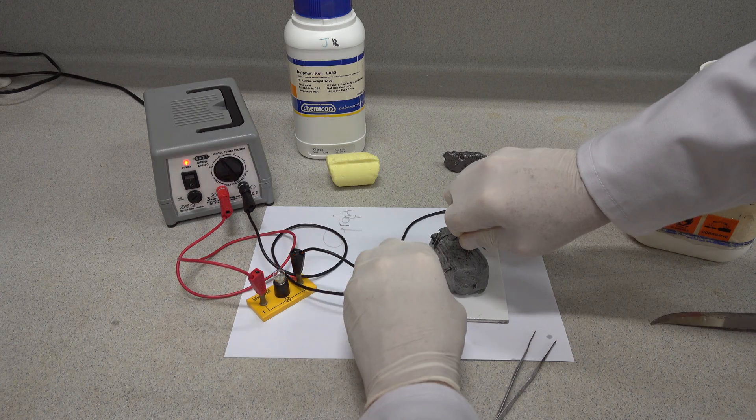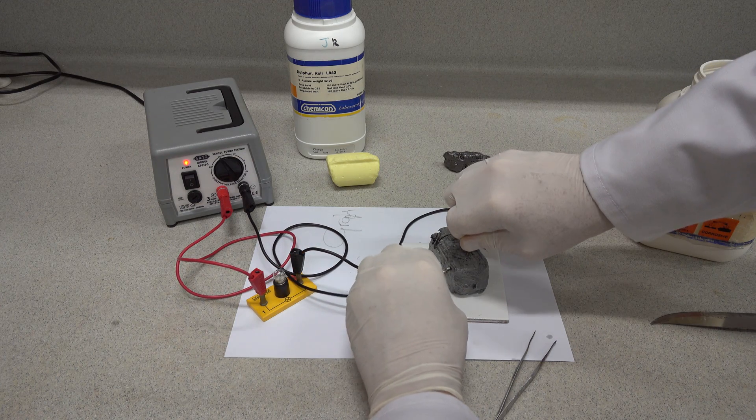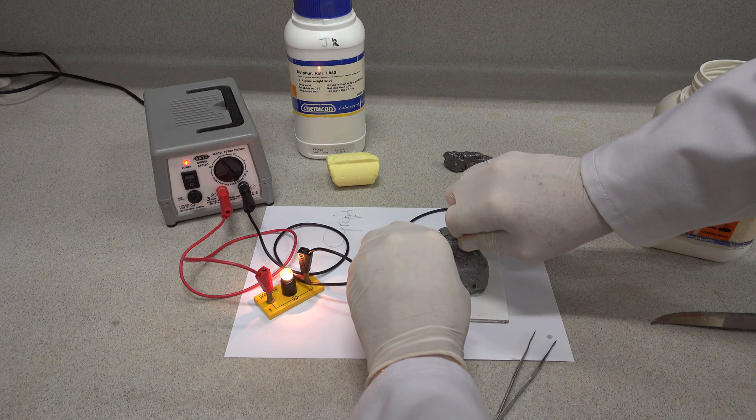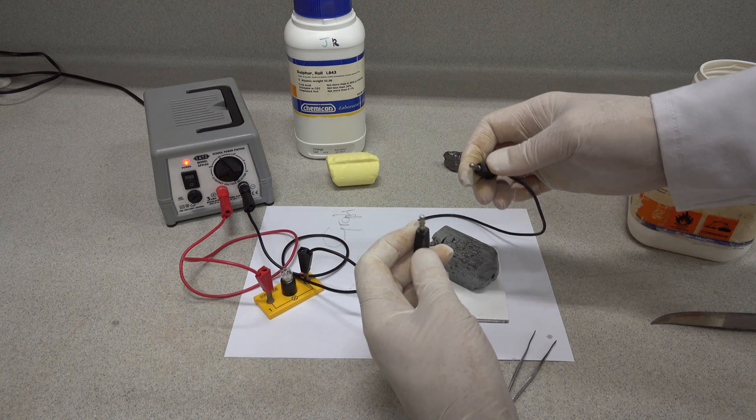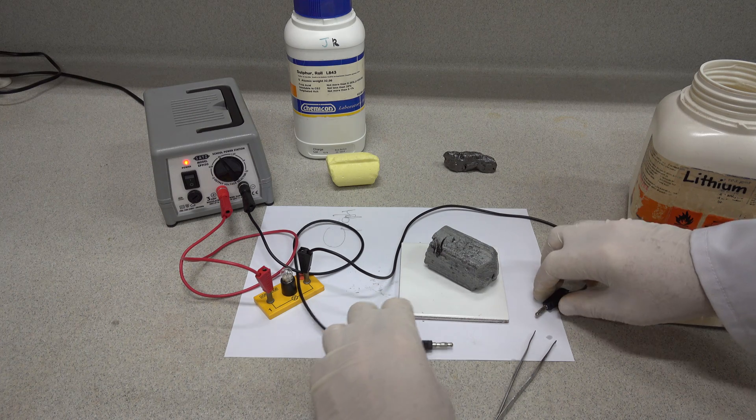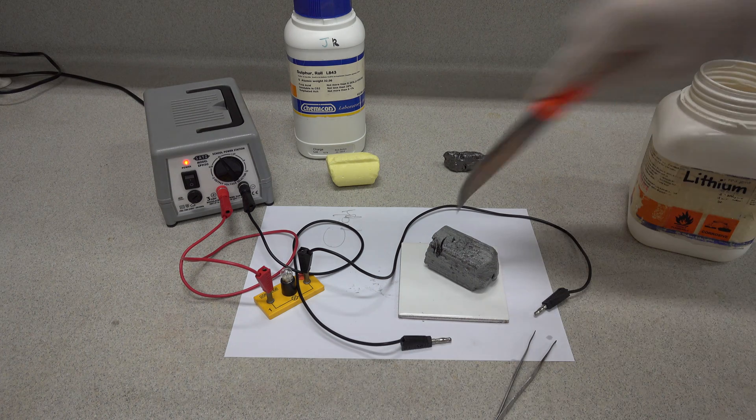If I can push the electrodes in - yes, look, okay - almost there. Pushing the electrodes there, we've got contact. Lithium does indeed conduct electricity. I'll have to clean the contacts up now that they've possibly been contaminated with some lithium metal.